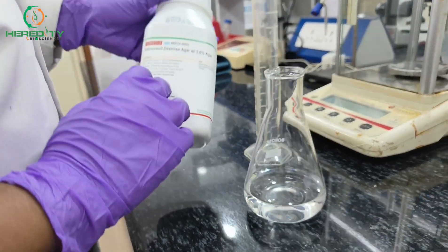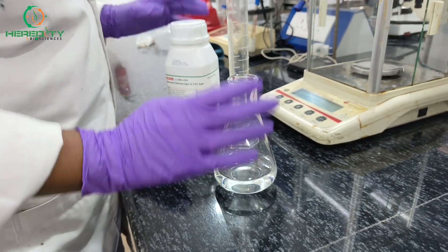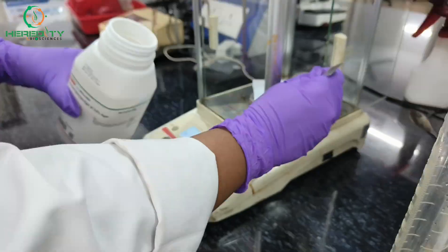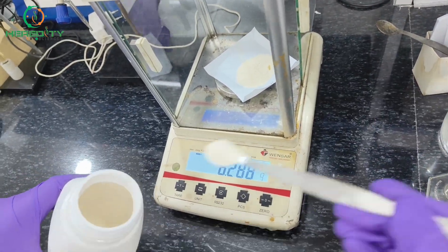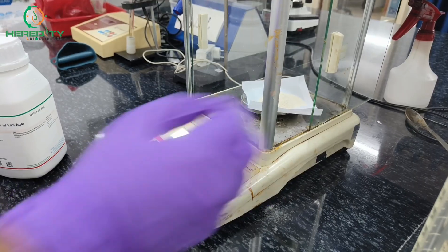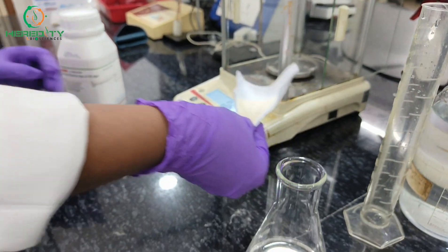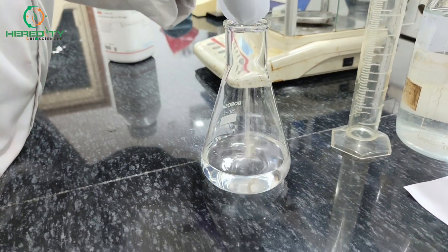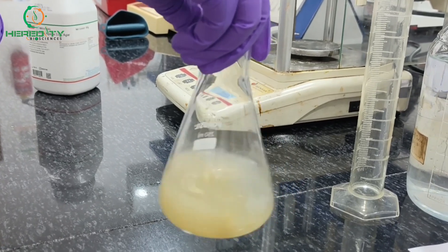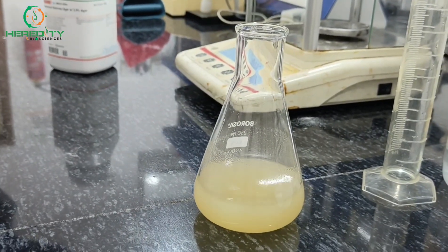8 grams of Sabouraud Dextrose Agar will be added in 100 ml of distilled water. Now we will add this 8 grams of Sabouraud Dextrose Agar into the 100 ml of lukewarm distilled water. Mix it by stirring — if you have a hot plate with a stirrer, you can mix it with the hot plate. Then plug it tightly for autoclaving.